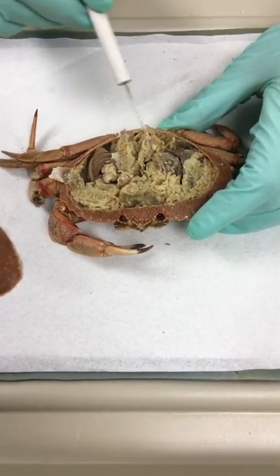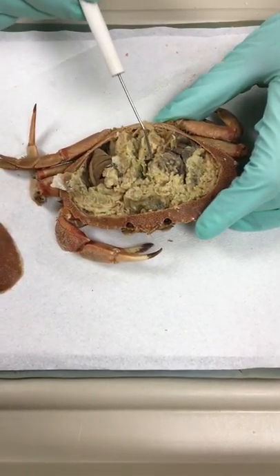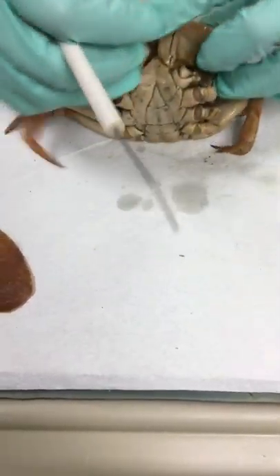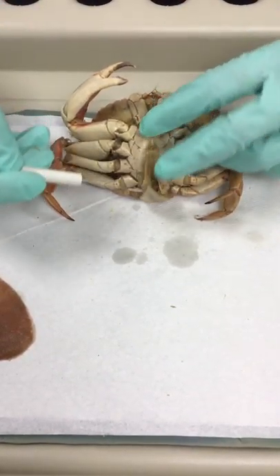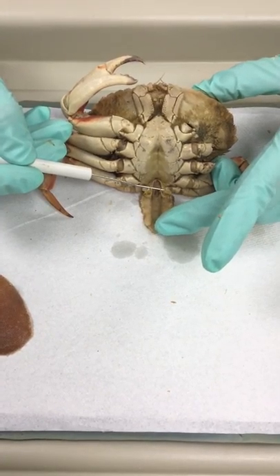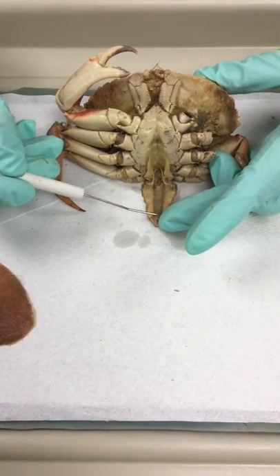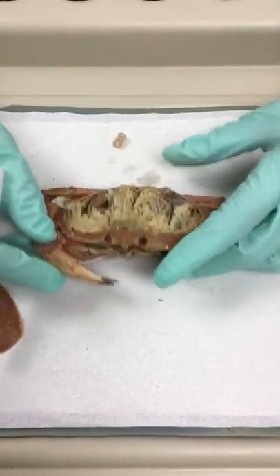Because this is a male, it has some testes here that are going to deliver the sperm to the copulatory structures right here. And the midgut attaches to the hindgut right here, or the intestine, before it goes out the anus.